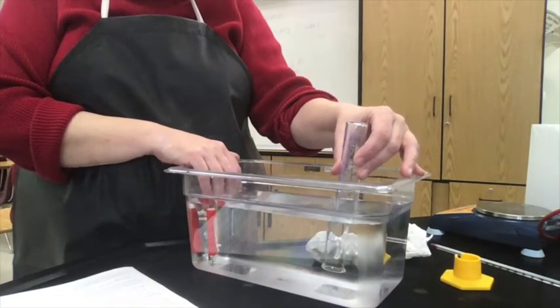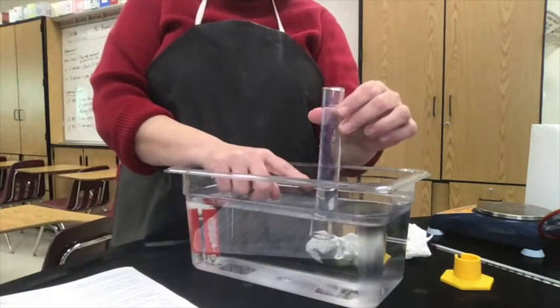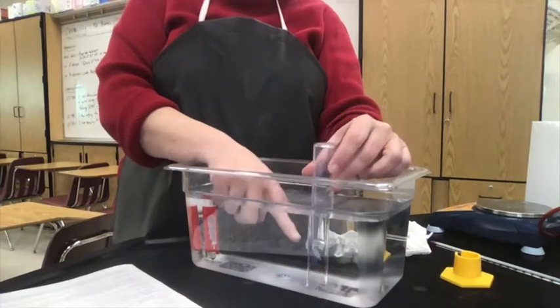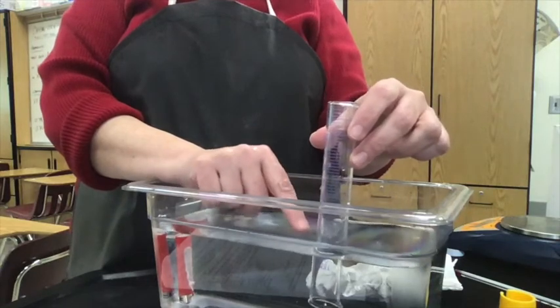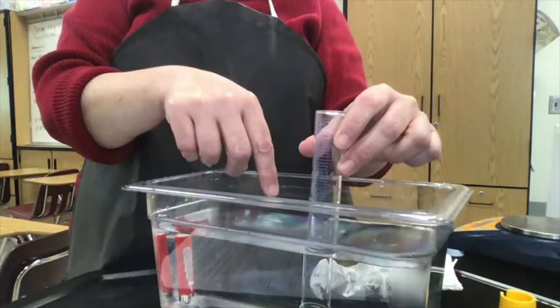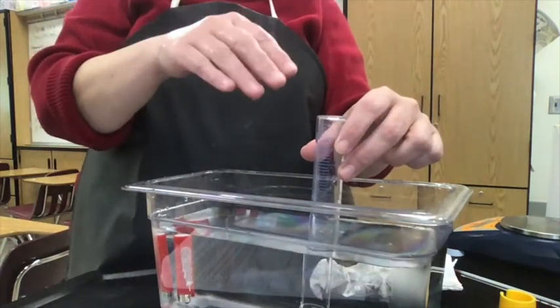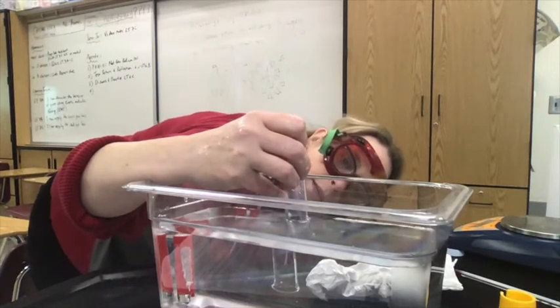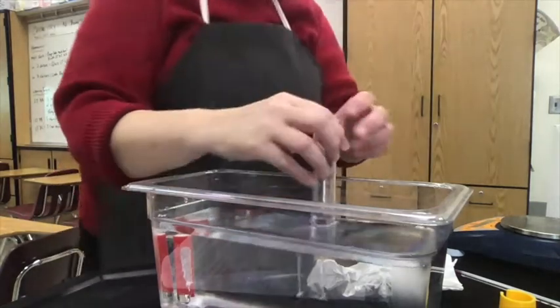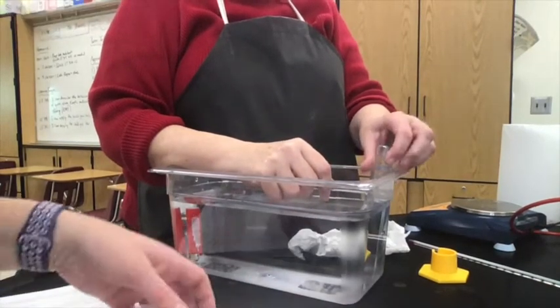We're now on step number four — position the butane lighter and collect 45 milliliters of butane gas. For step six: if you raise and lower the graduated cylinder, you can see the water level inside changes. When I read it, I have to make sure the water levels inside and outside are equal, because I'm going to use the atmospheric pressure pushing down on the outside as the pressure of the gaseous mixture inside. Reading it — it looks like it's right at 44.0 milliliters, reading to the tenths.